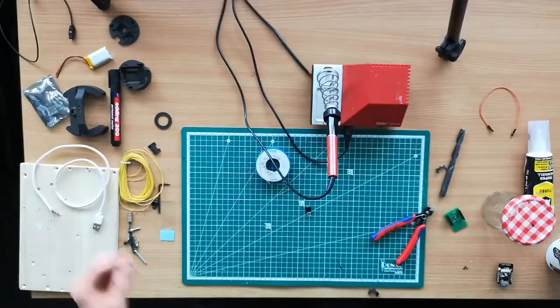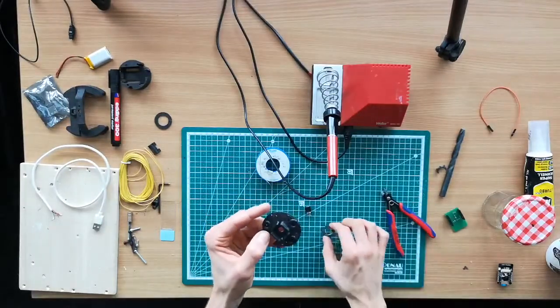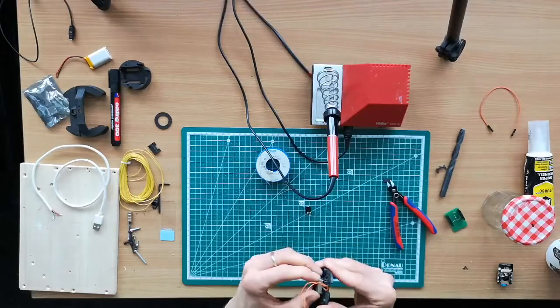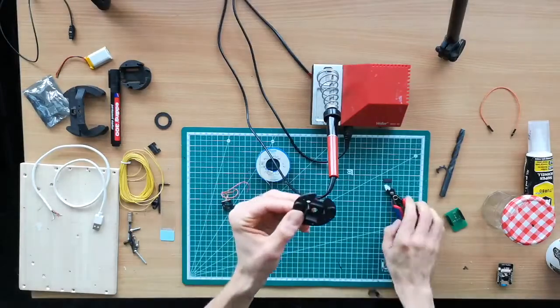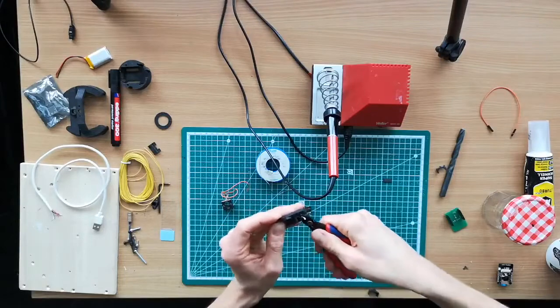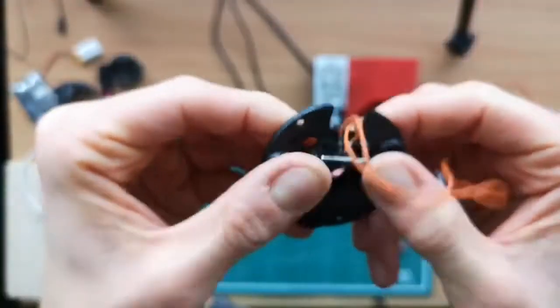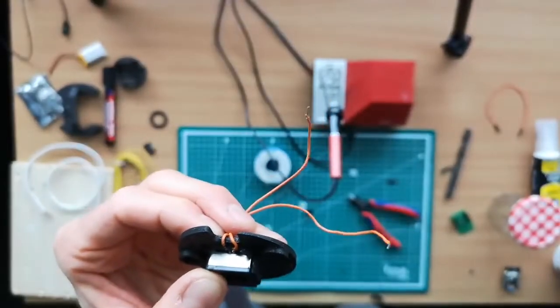And what we're going to do now is, this part here goes in here. So we have to make sure that the wires in the end follow this path. So we have to cut out this piece here, and then the lens essentially mounts here so that it's fitting in here. Maybe a bit too perfect, so I have to get rid of a bit more material. Almost perfect. So now it's kind of done. This way you can make sure that the lens sneaks in here, press fit, and then the wires go here. And this here then is connected to the PNP transistor, which I'm showing you now.